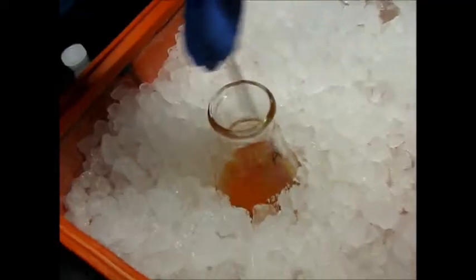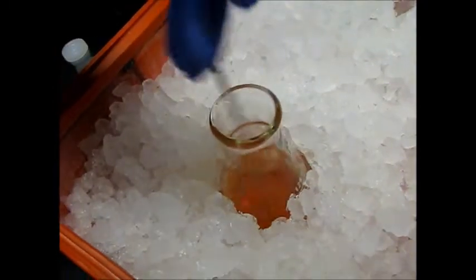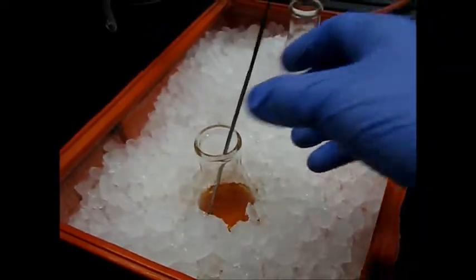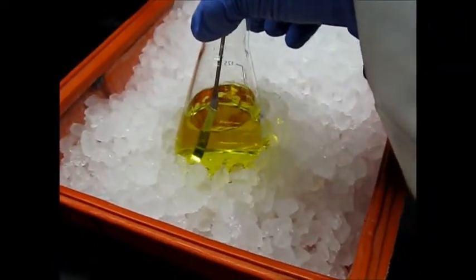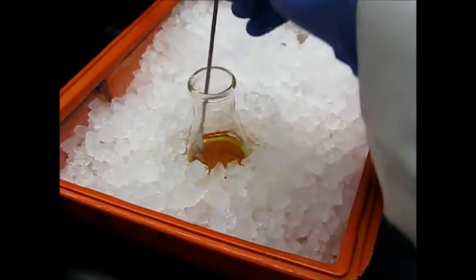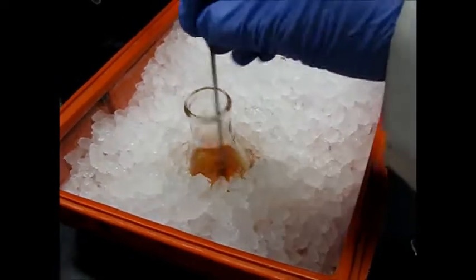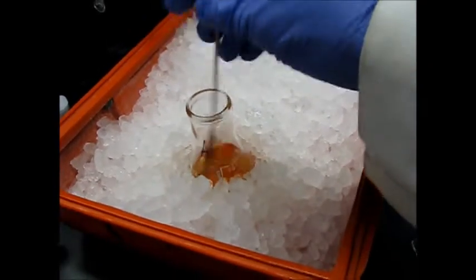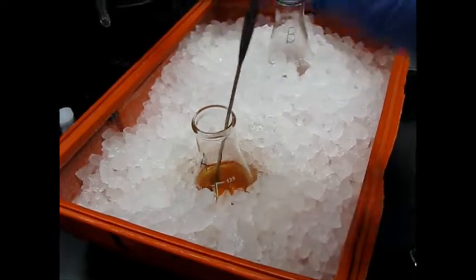Now it is showing yellow color. I will need to take another litmus paper. All the yellow color is from aniline. And it will take some time because we have only 10% aniline here. So we will leave it here for some time.